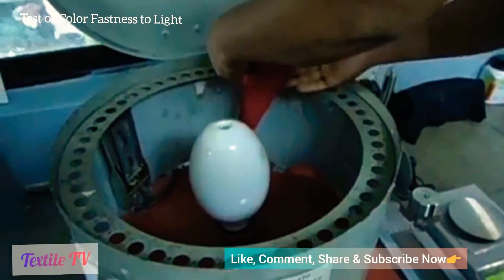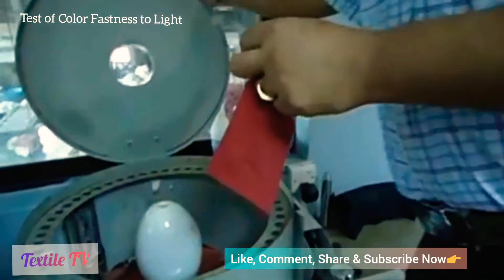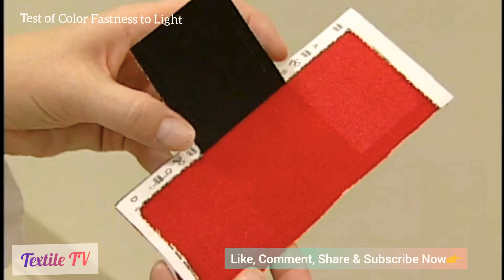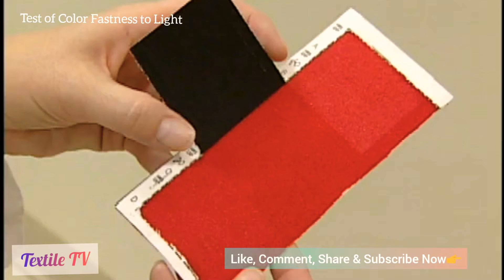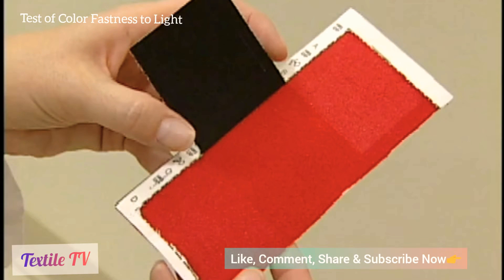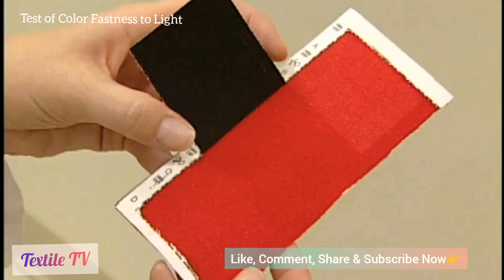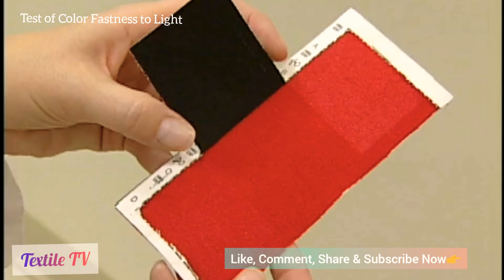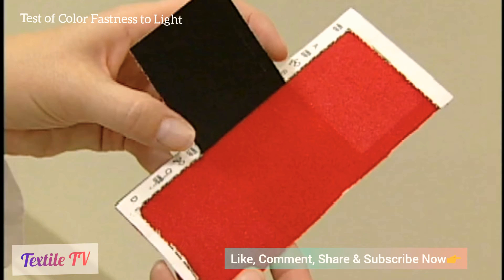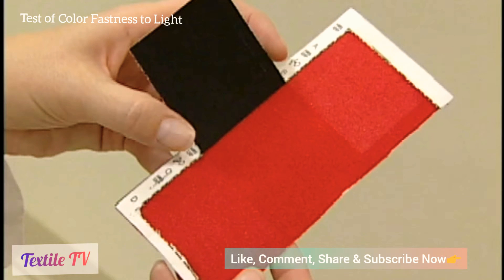After 20 hours, samples are removed for examination so that the sample can be evaluated. The sample shows lightfastness fading after exposure to light for 20 hours. It is obvious that the red shade has lightfastness issues.